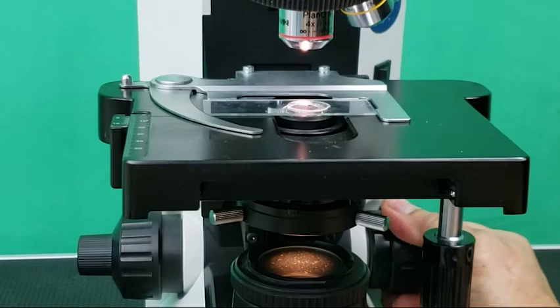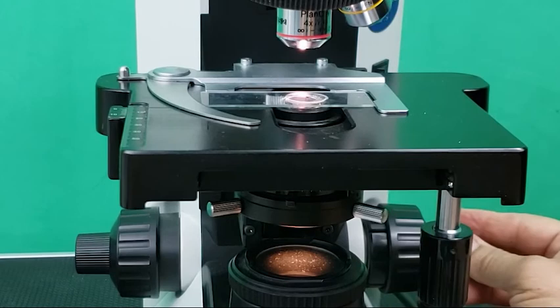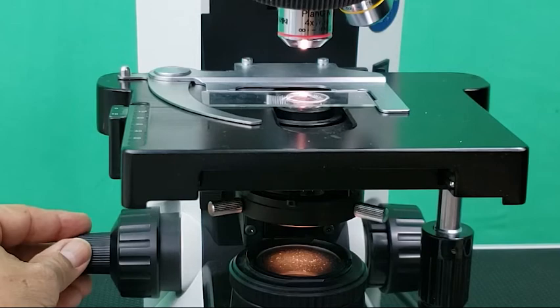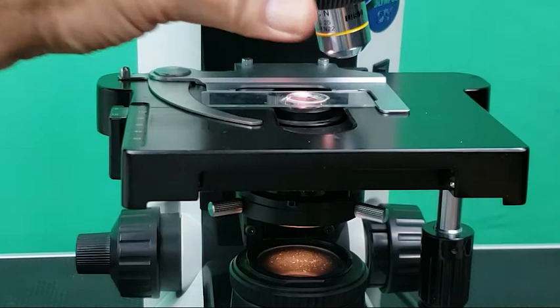Compound microscopes are parfocal. That means, once you get a slide in focus on scanning power, it should also be in focus on low and high powers. Therefore, you should only use the fine focus knob to sharpen the focus.